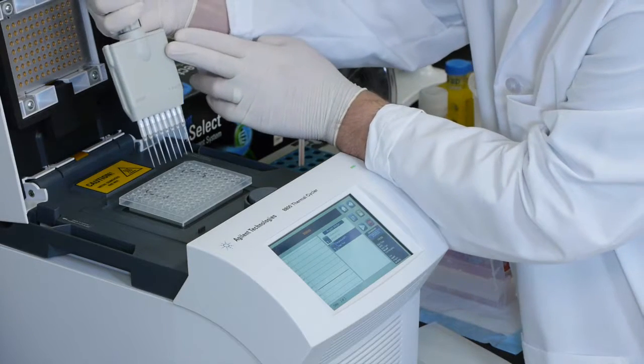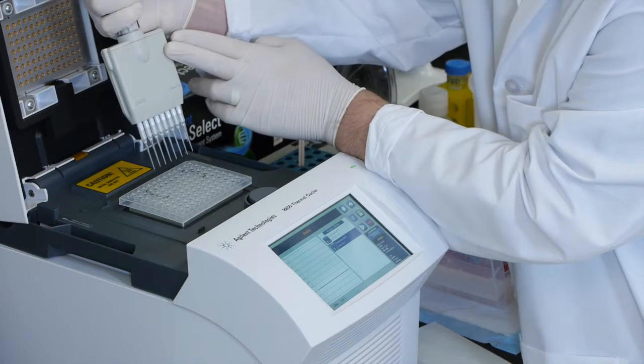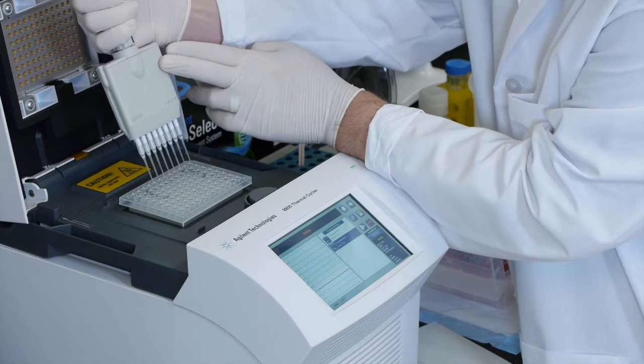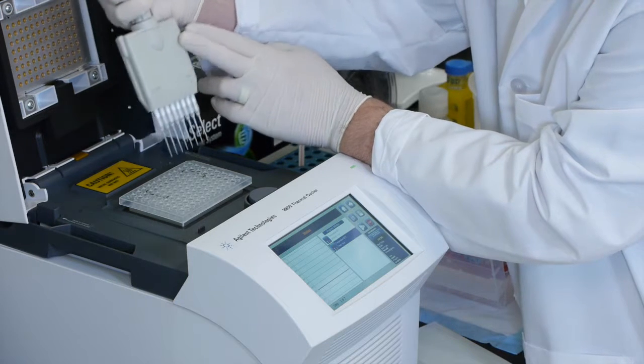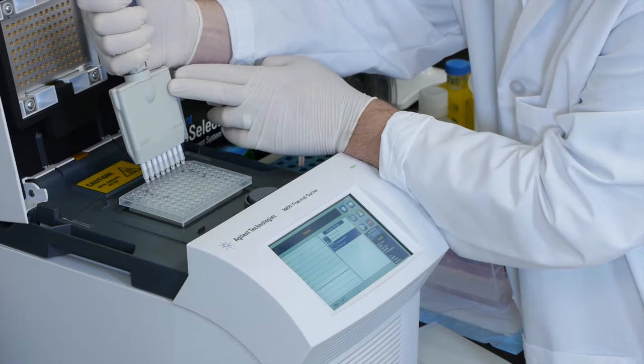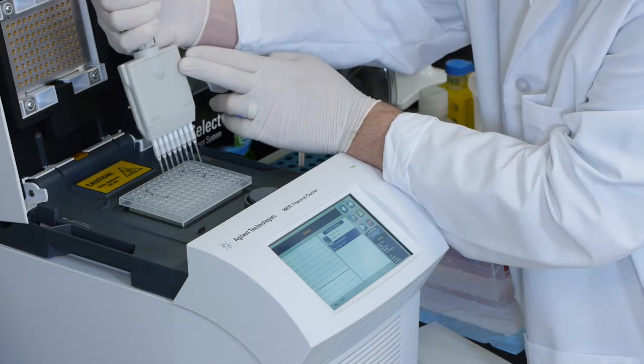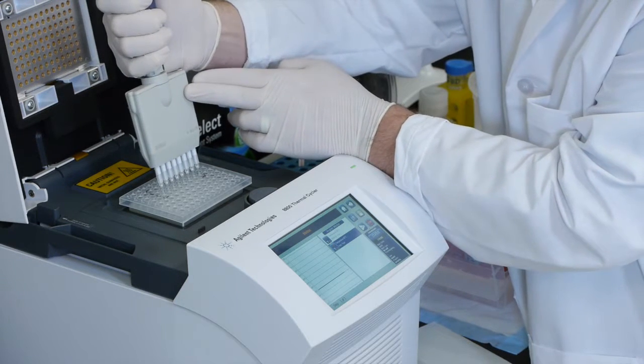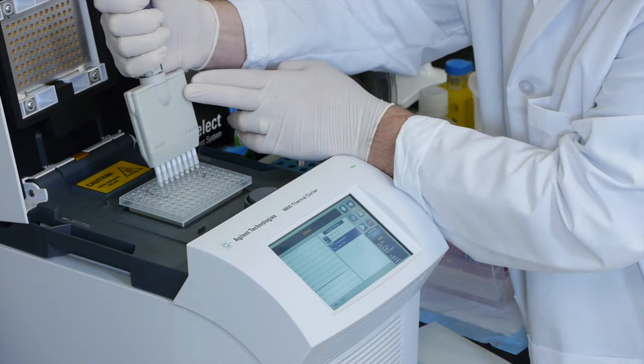So step one is going to be to transfer hybridization buffer in this top row with our capture library in this bottom row. We mix by pipetting up and down at least five times.